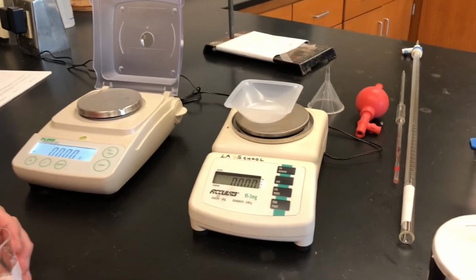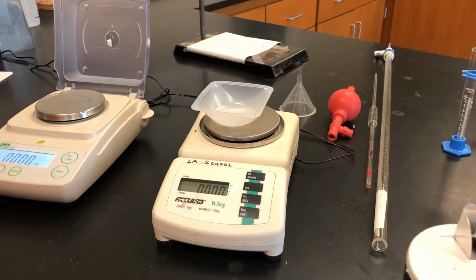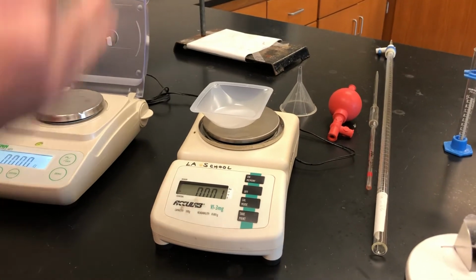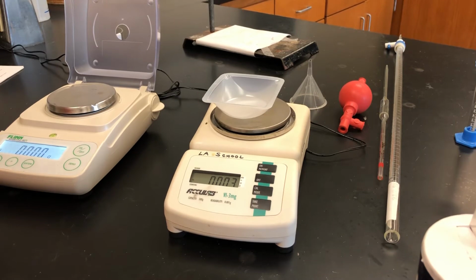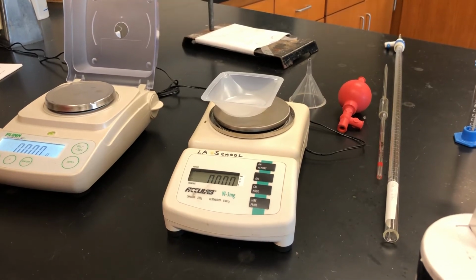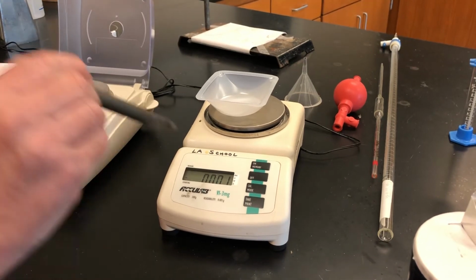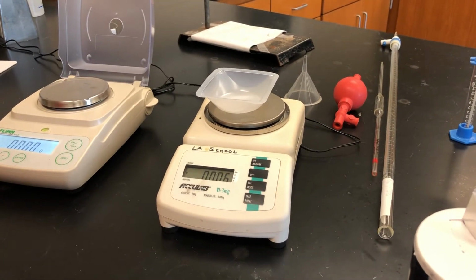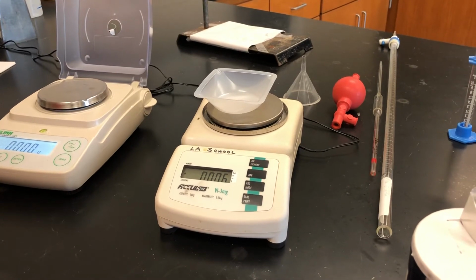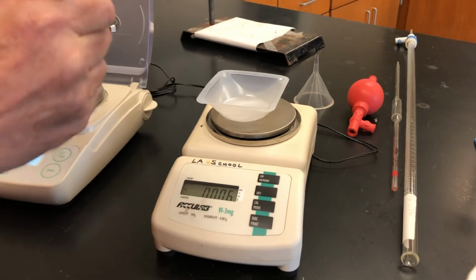And when you read through a chemistry procedure, it's going to tell you to weigh things out or get some specific volume of liquids. Personally, I don't spend a lot of time trying to get exactly 0.500 grams of salt, okay? I'm going to say this expression quite often: don't chase the rabbit. Just get something that's fairly close to what you want.